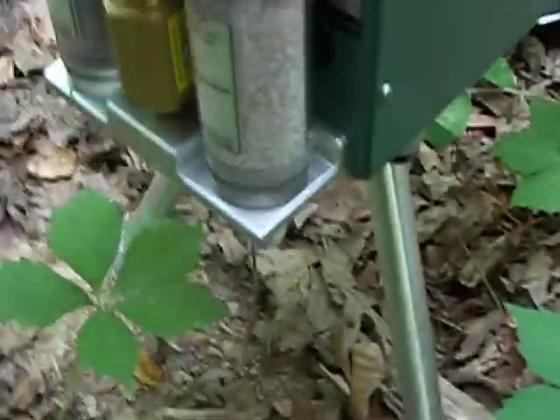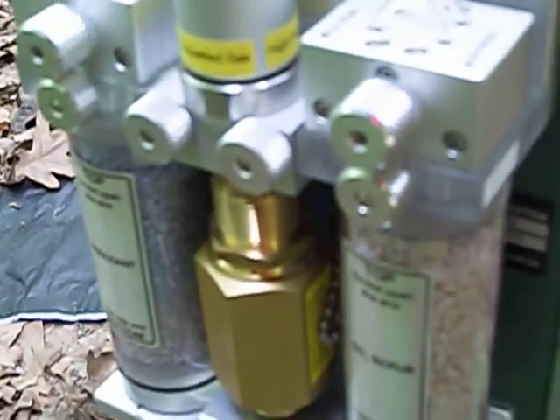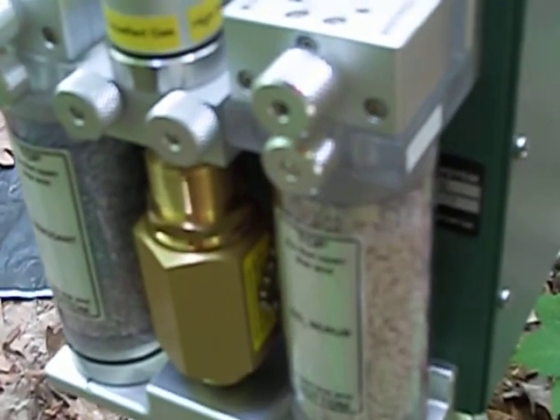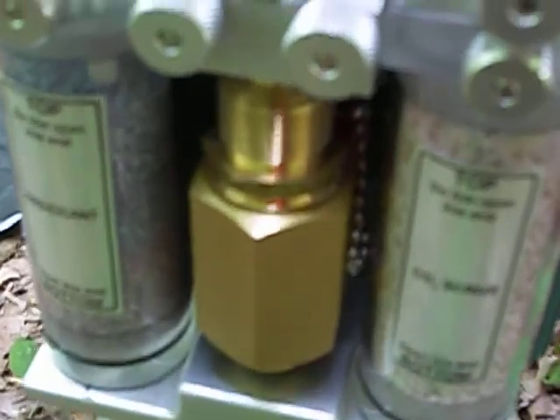This is the scrubber for the relative humidity in the air. So we pull all the humidity out of the air, and we set the humidity levels at the leaf to what we want them, using the humidity that's in the chamber. Pretty neat unit.